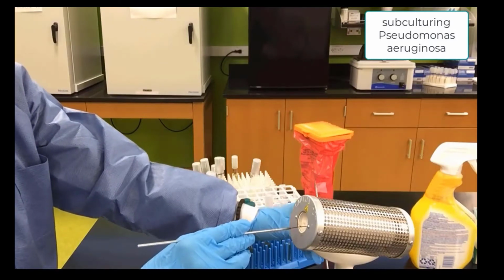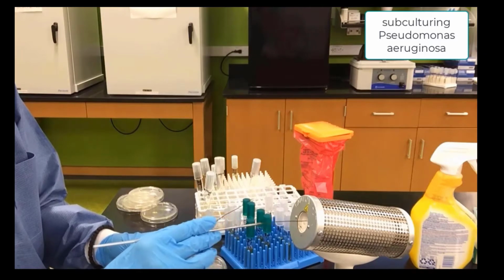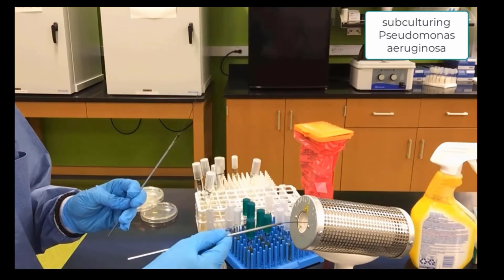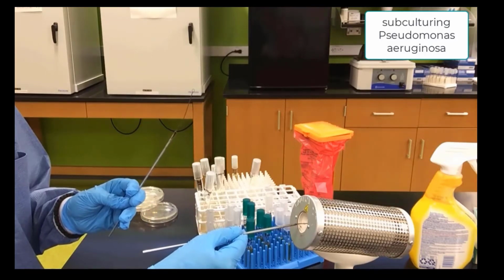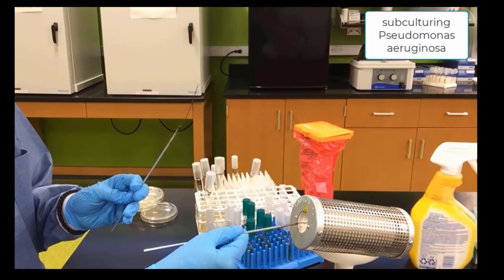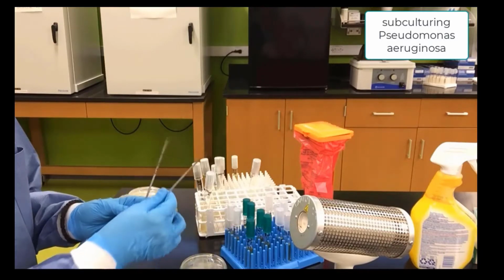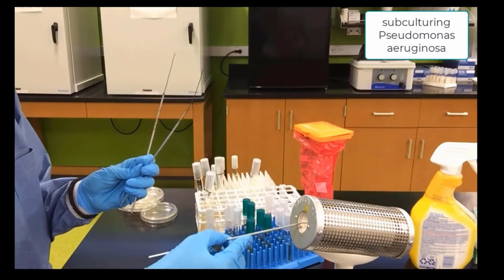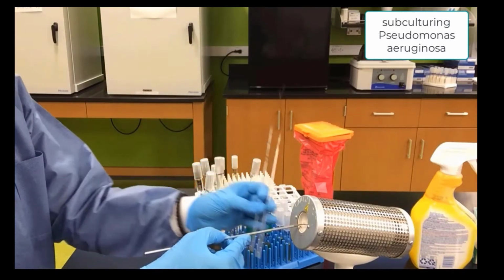We burn for about 10 to 15 seconds. The wise thing to do in order to go through the lab a little faster is to sterilize maybe 2 or 3 loops, and that way while one is cooling you can be using the other one. And you'll see we are going to sterilize a 3rd loop here for our lab.